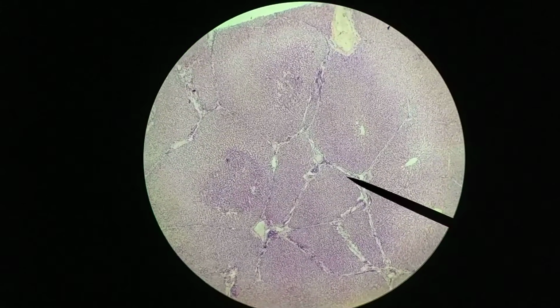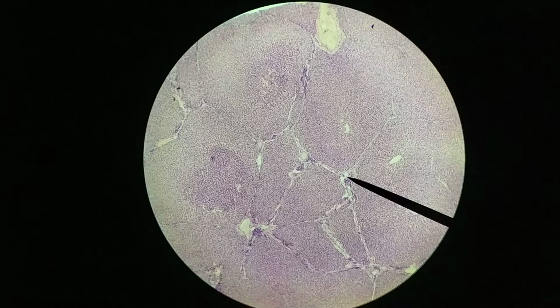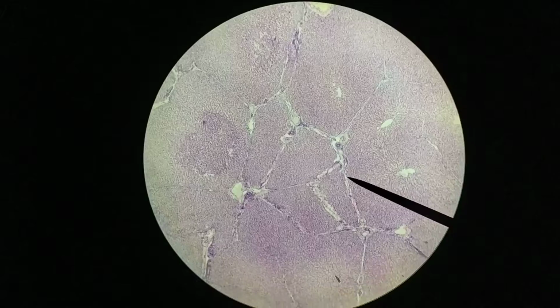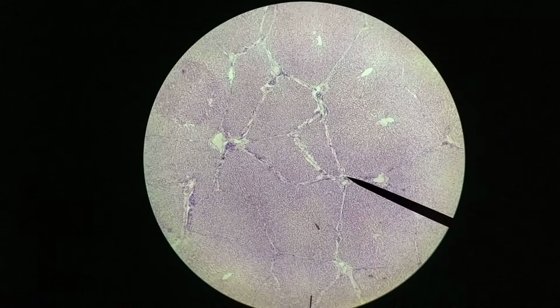Now in this case we have a fairly large amount of connective tissue, and these portal triads are fairly obvious, and that's because this is actually a slide of the pig liver, so it's a little bit easier to identify things here. The Glisson's capsule, as it goes in, has a bit more connective tissue. If we were to look at human liver, it probably wouldn't be quite this obvious.